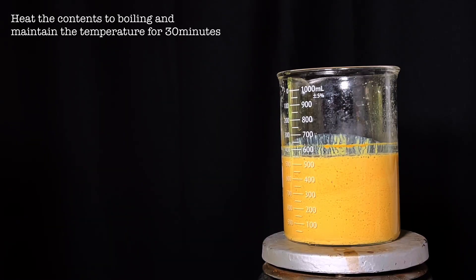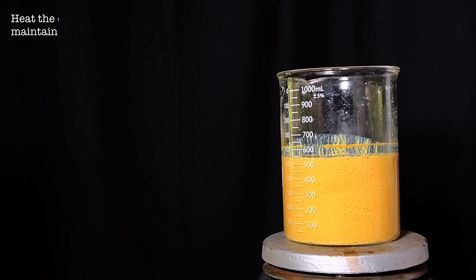Now heat the contents to boiling and maintain the boiling for 30 minutes. This makes sure that the reaction is complete.